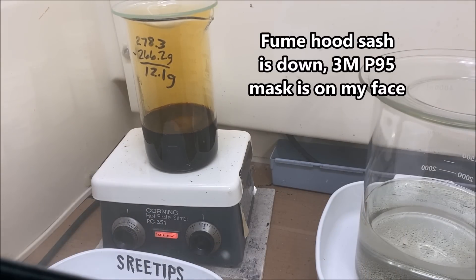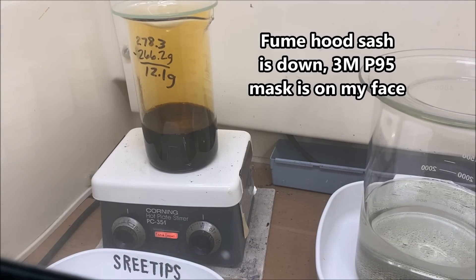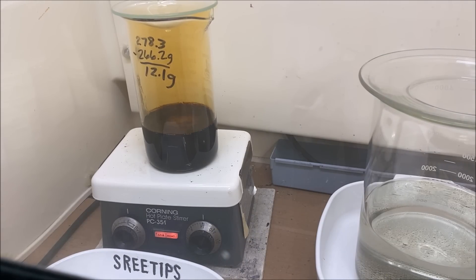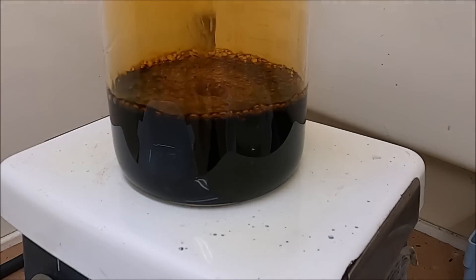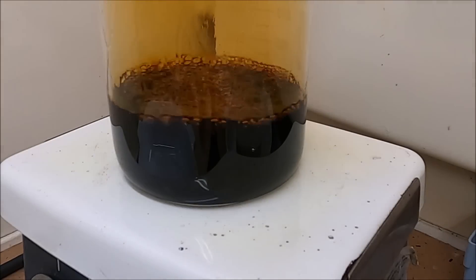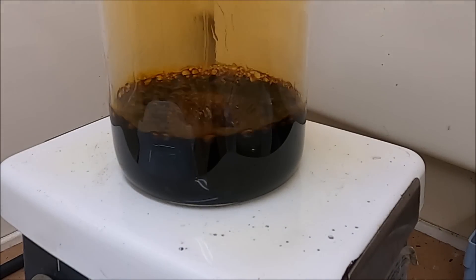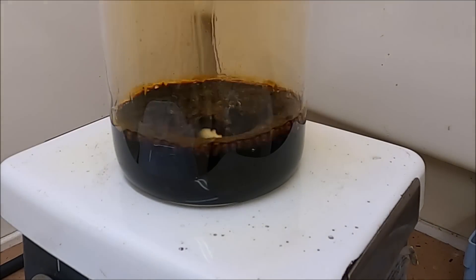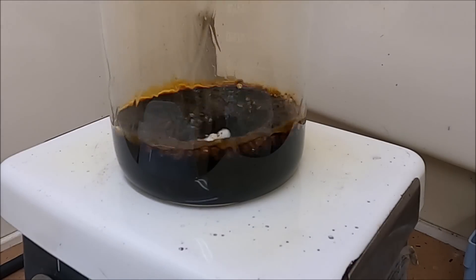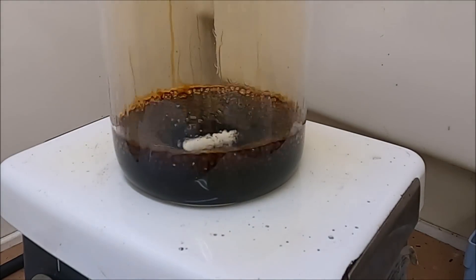It's been on the heat now for about 15 minutes, so what we're going to do now is crank this heat up and boil the solution — see if we can get that platinum to dissolve in the hot aqua regia. This is about a two-and-a-half hour time lapse boiling the solution down to evaporate off all the liquid. We should have sufficient aqua regia in there to dissolve all the platinum and put it in solution. You'll notice the fumes start to clear up and go away, but then as the solution boils down and starts to thicken the fumes reappear.